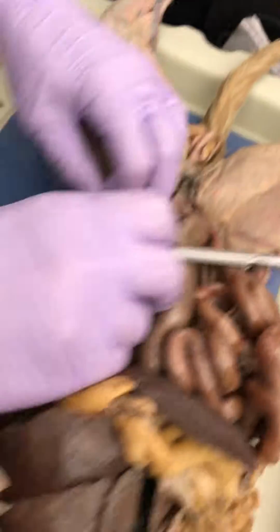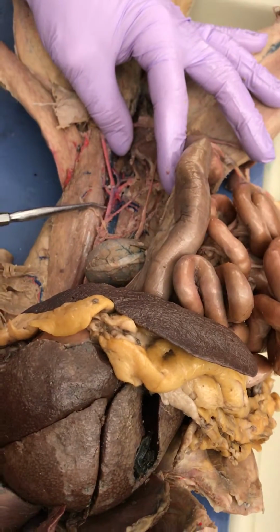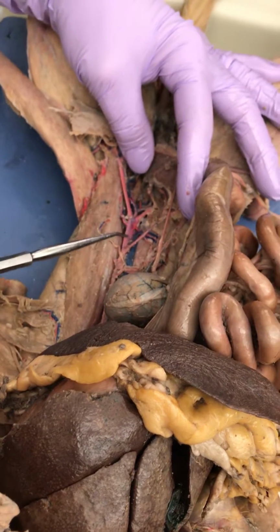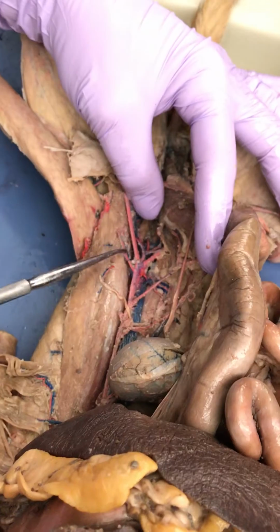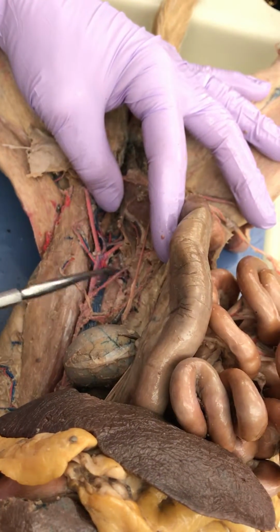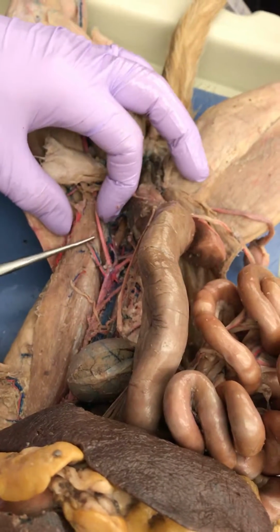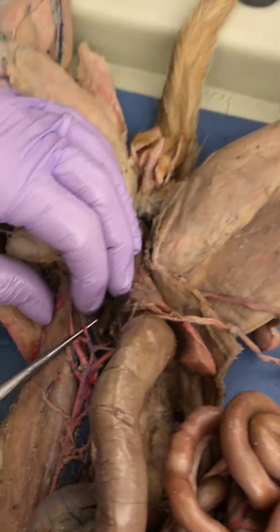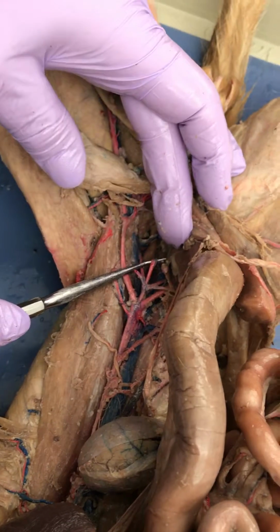So back here. Everybody told me that was inferior vena cava. What's that? Abdominal aorta. And then what's this one? Iliolumbar. Yeah. And here it is on the other side. See it? Okay, how about this one? External iliac, good. Internal iliac. Internal iliac, and just dissect it out really well, ladies.